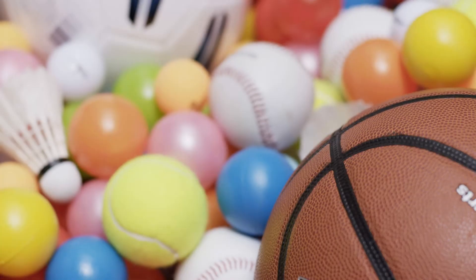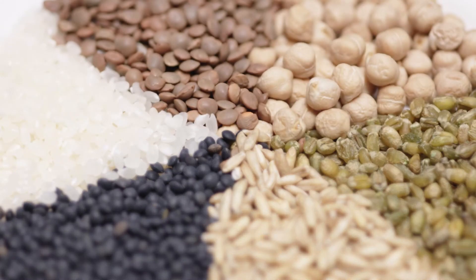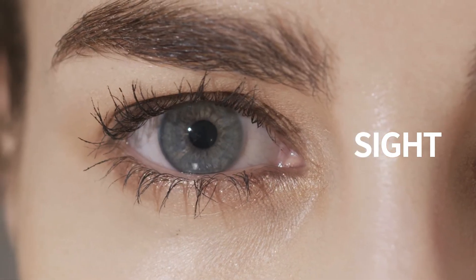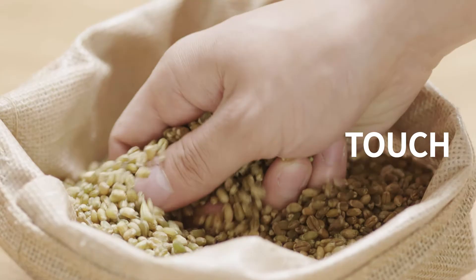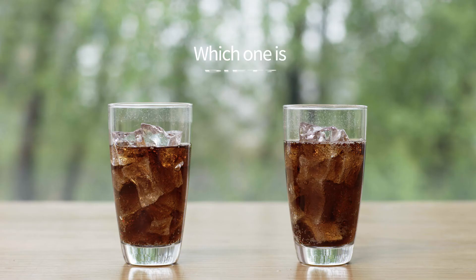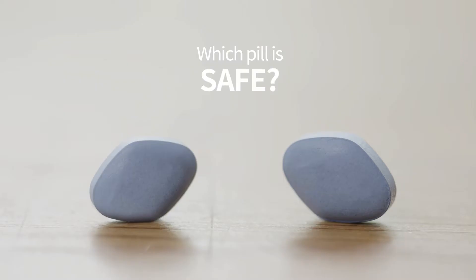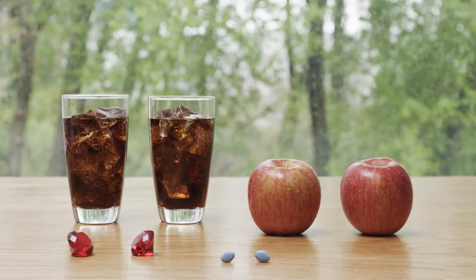The world is full of things to explore and we gain an understanding about our world through sight, taste, and touch. But sometimes our senses don't give us all the information we want. Now there's a solution that can help identify things around you with the click of a button.